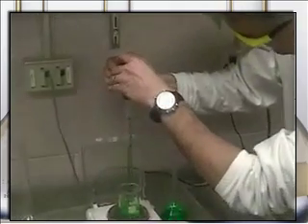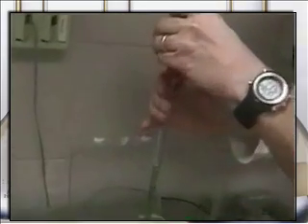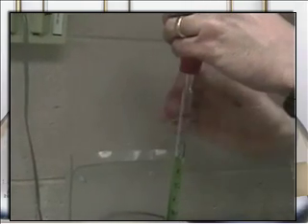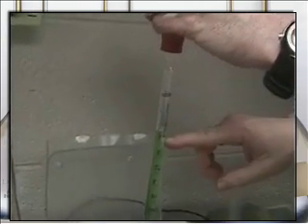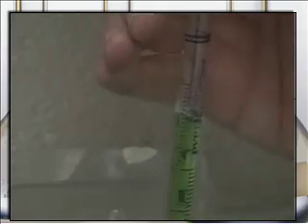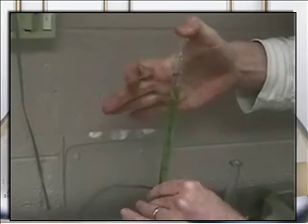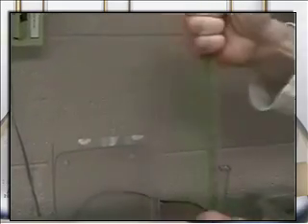Now, what I'm going to do, actually, I want to put this in my left hand. I'm squeezing with my left hand because with my right hand I'm going to take my thumb and flick the bulb off. This is the 0 line right here. I'm going to go above the 0 line and flick the bulb off, put my thumb over the top and squeeze real tight. So now you can see I'm squeezing really tightly and the liquid is not changing. If you look carefully, it's above the line. The 0 line is about right there.